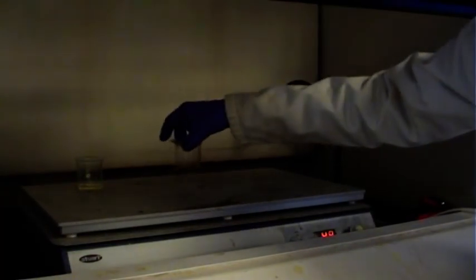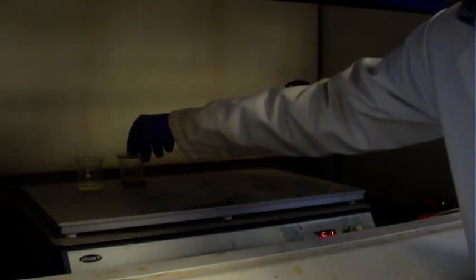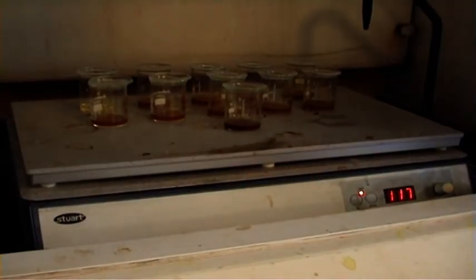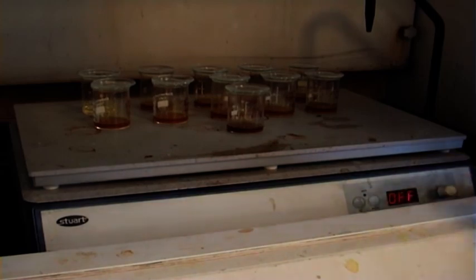One of the more common digestion methods is the hot plate open vessel approach. The samples are placed on the hot plate and covered with a watch glass to reduce the rate of evaporation. Note 3 replicates of each sample for each site. A procedural blank and a certified reference material are being used here. This digestion process often takes up to 2 hours and at a temperature just above the boiling point of the acids.